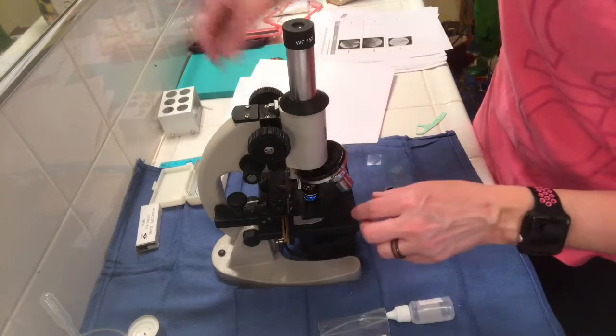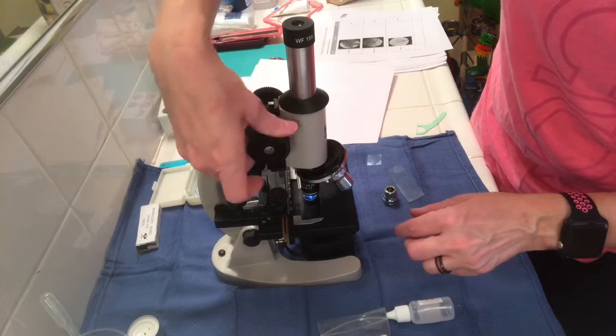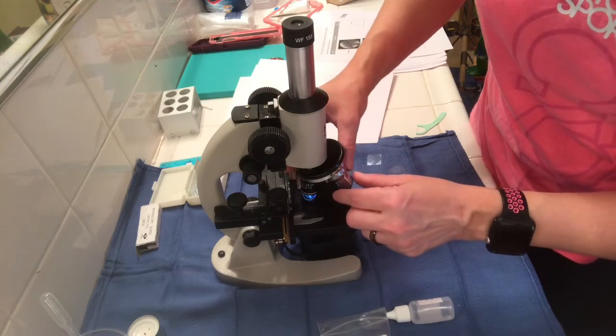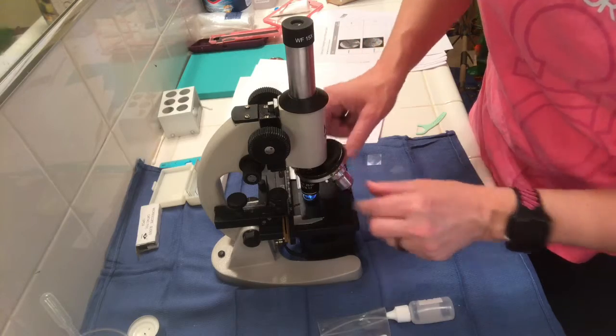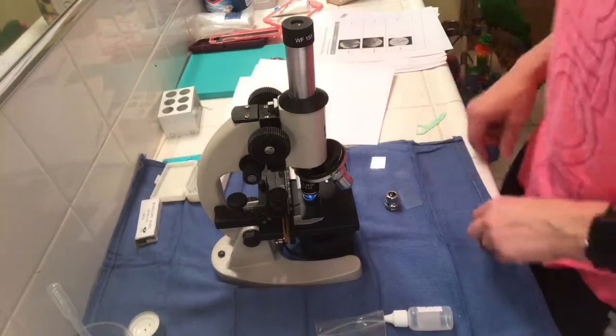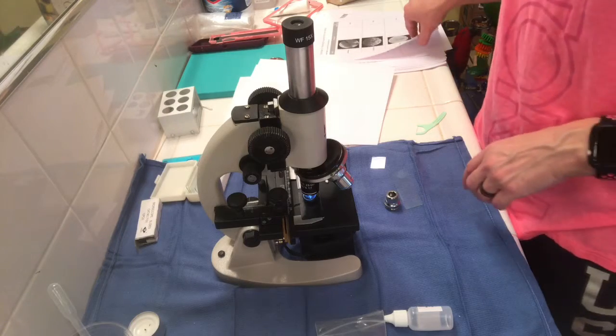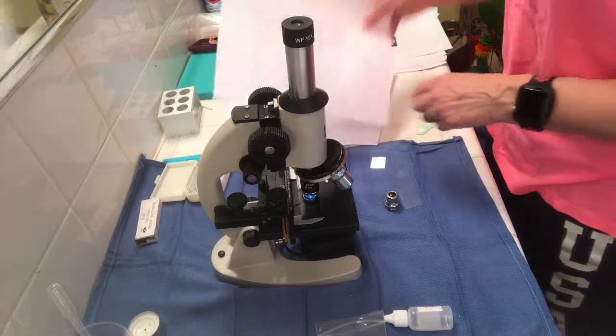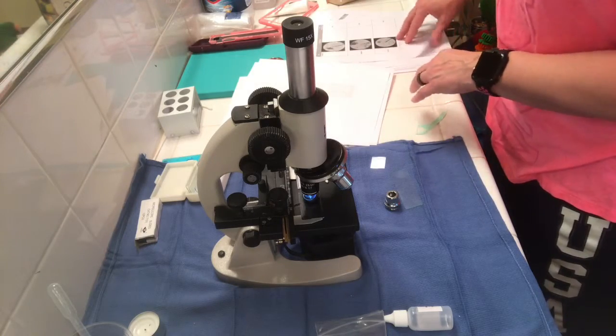gotten all my different lenses and focused on it and then changed to the oil immersion, and it was too close to the slide when I turned it, and it scraped the slide a little bit. So it damaged a little bit of the E-slide. That's one of the things that I found that was helpful during the lab to visualize things.